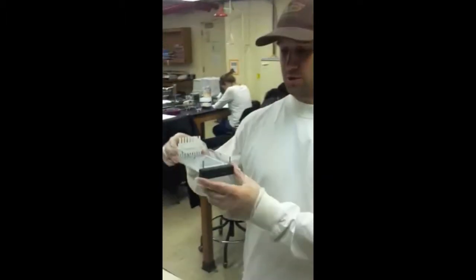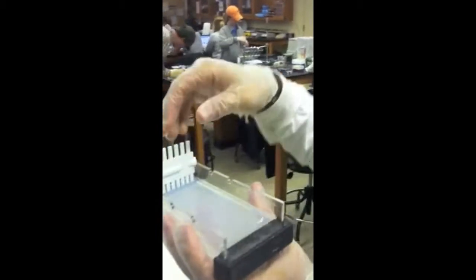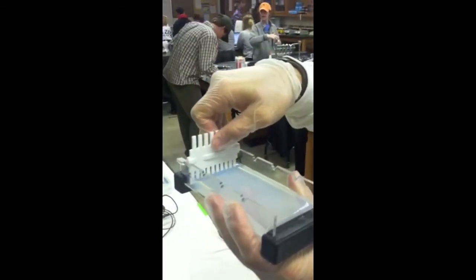And then allow 15 to 30 minutes for it to congeal completely. This is what your finished gel product should look like — completely congealed — and you're going to take your combs out of the product once done.